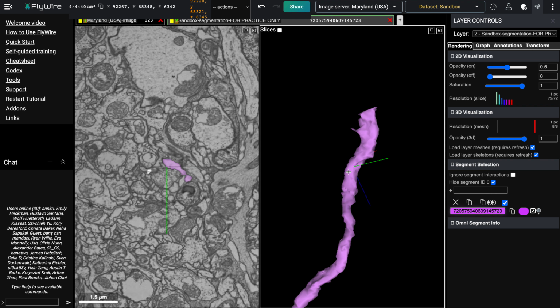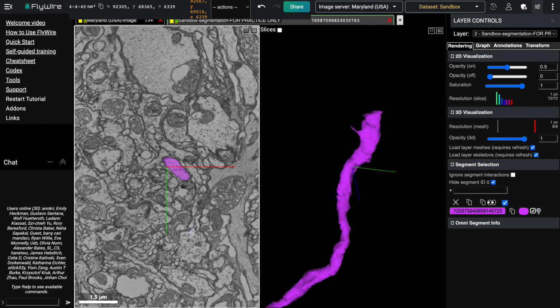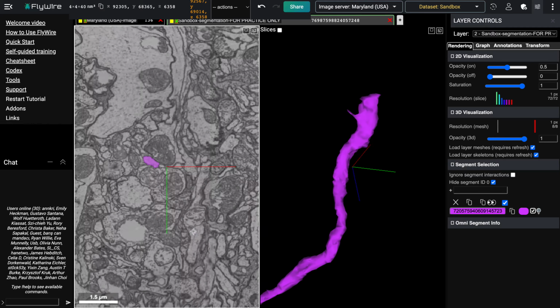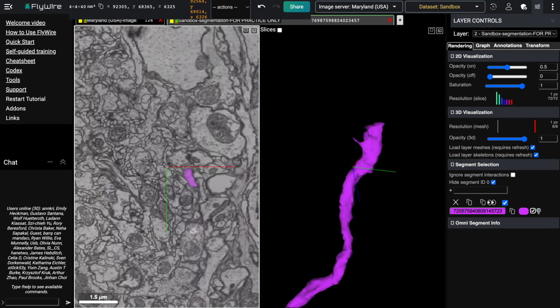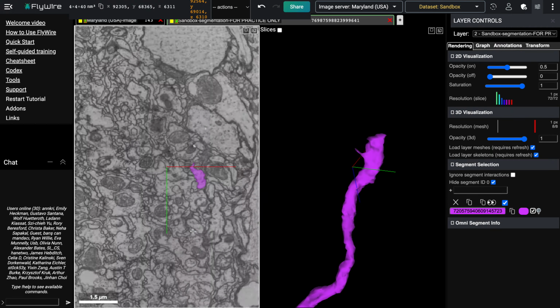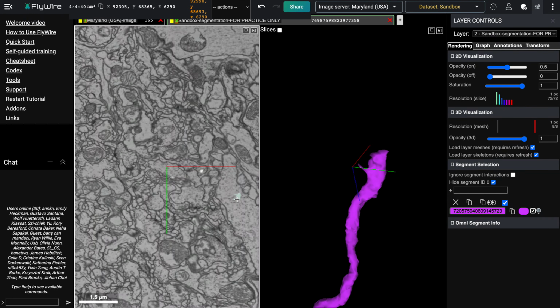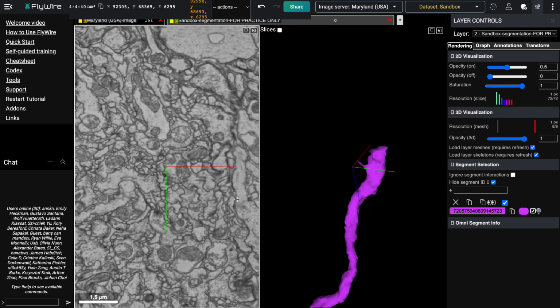So to figure out what's going on with this branch, let's start a little bit further down the branch and we can scroll through as we normally would. As we're going down the branch, we've got this fluid motion as we scroll through until we come to this end point, at which point it just terminates suddenly.